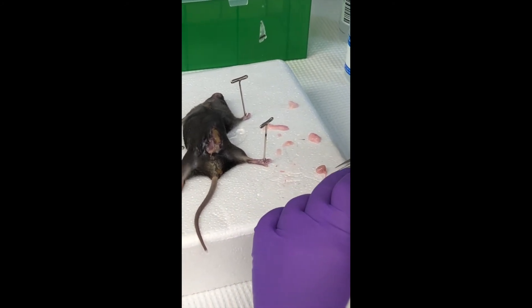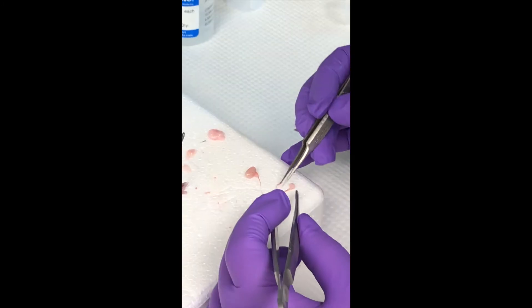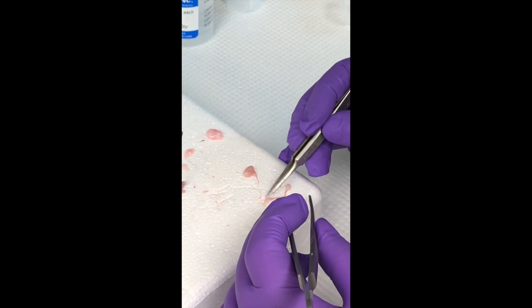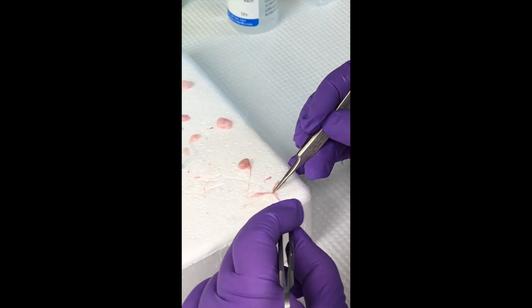So there's my testy. And then here's the epididymis — I'm trying to take it over there. That's the caput right there, and this is the cauda down here. And I'm getting rid of this fat here.